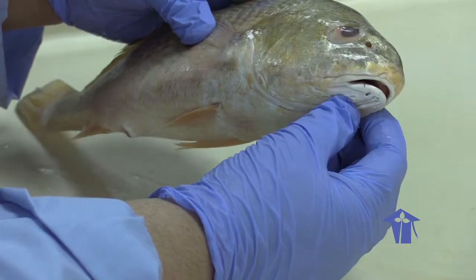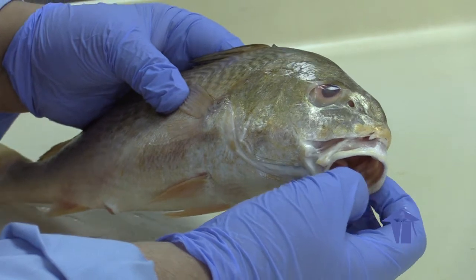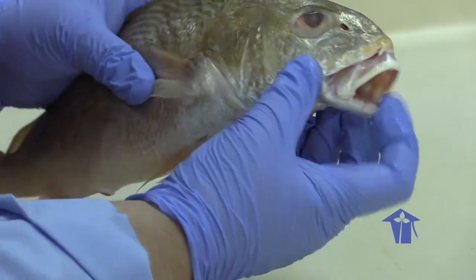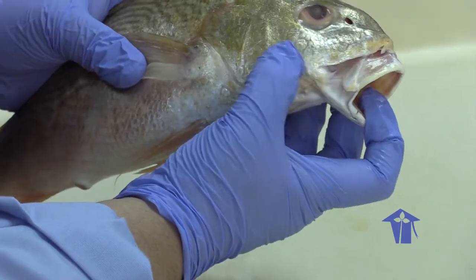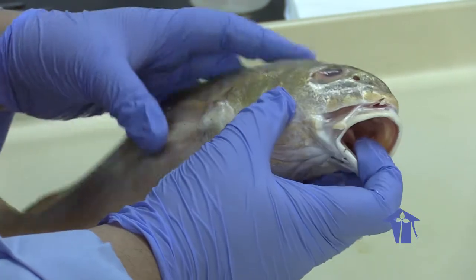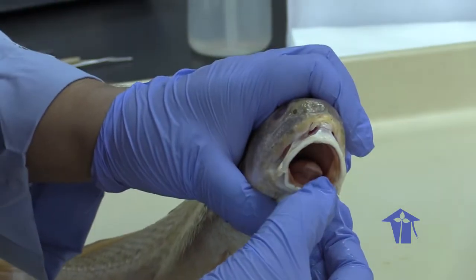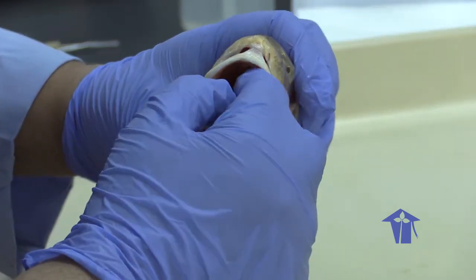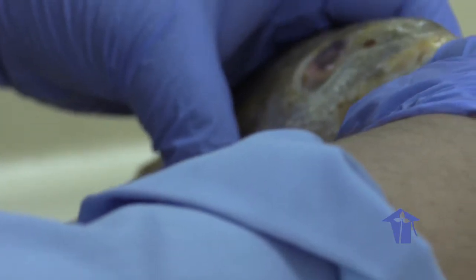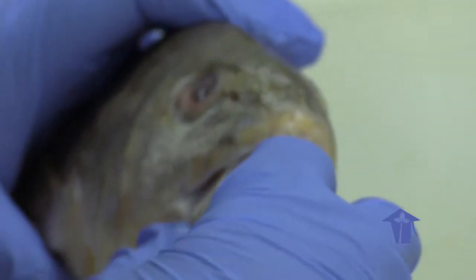So one thing to note, the mouth doesn't look that big, but if you were to open it out, you can see that the mouth is actually protrusible. So the mouth of this fish can expand to a great size in order to engulf large pieces of food, right? If you were to look down the mouth, you would see that there is a tongue. The tongue, again, is basically to raise and lower the mouth, right? Rather than for tasting and manipulating of food.